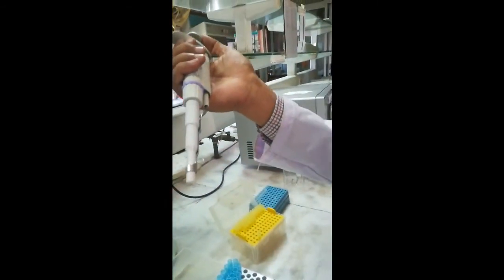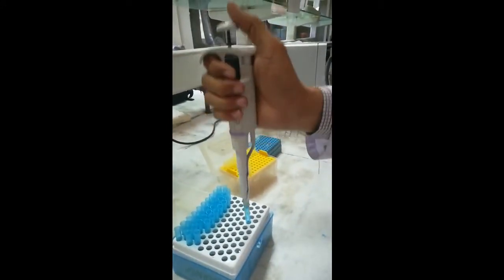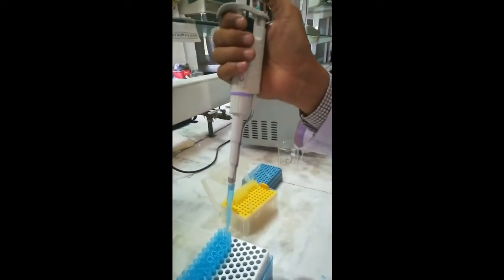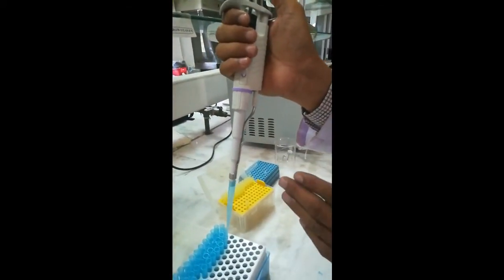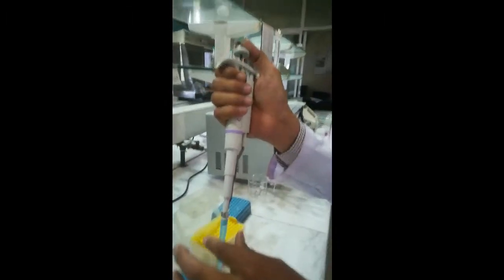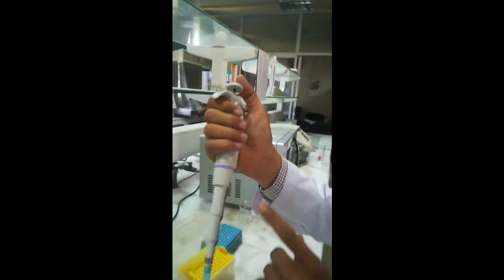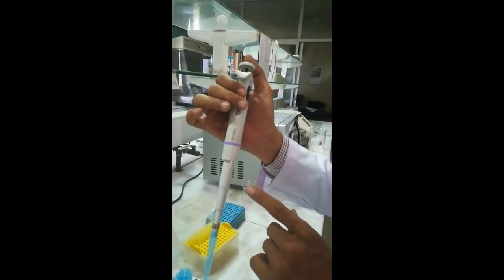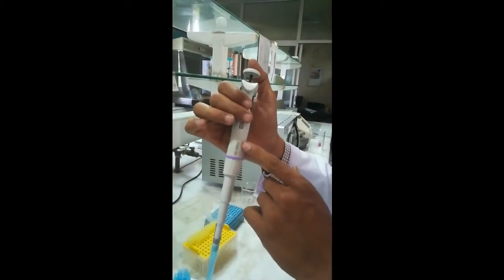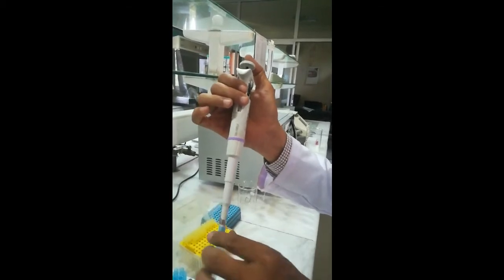Micro pipettes require another gadget called a tip. There are different capacity pipettes, and every pipette uses differently colored tips. For the 100 to 1000 microliter pipette, we use blue tips. After attaching the blue tip, we can adjust the volume we want to measure.